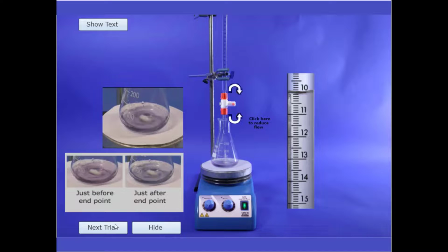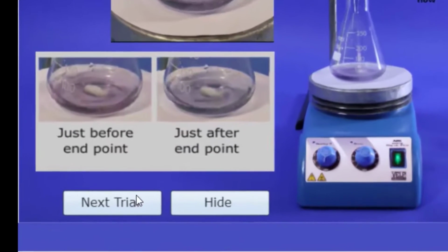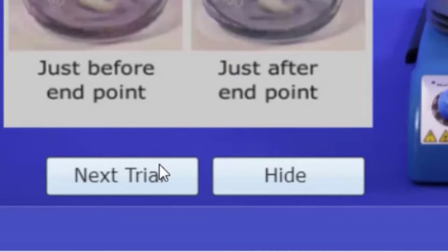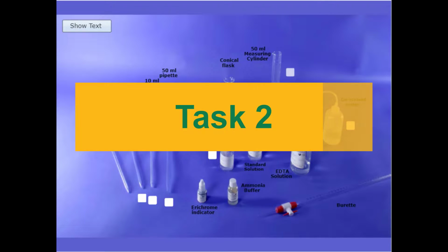At the endpoint, the last of the pinkish tinge disappears and a blue color is left. The standardization of the EDTA solution should be repeated at least twice. When you have completed a titration, click on Next Trial to set up your next titration. Once you have completed the standardization process, you're ready to move on to task 2.